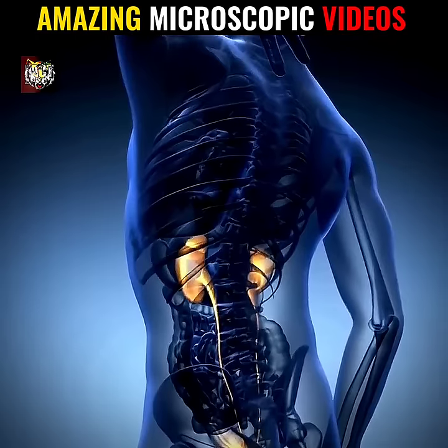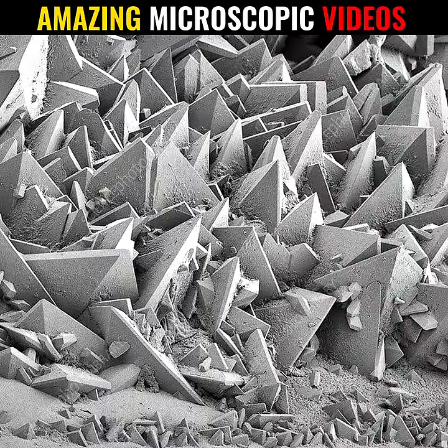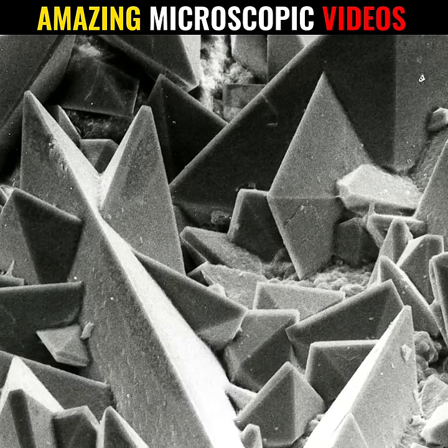Number 4: you must have heard about kidney stones — so this is what kidney stones look like under a microscope.